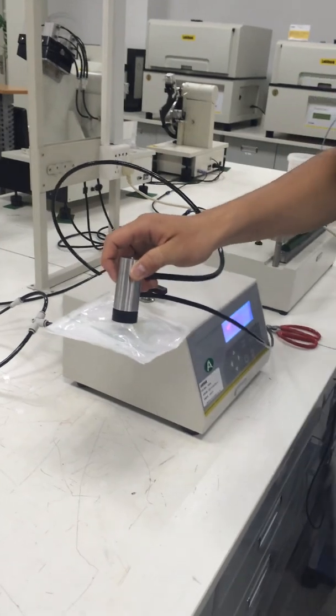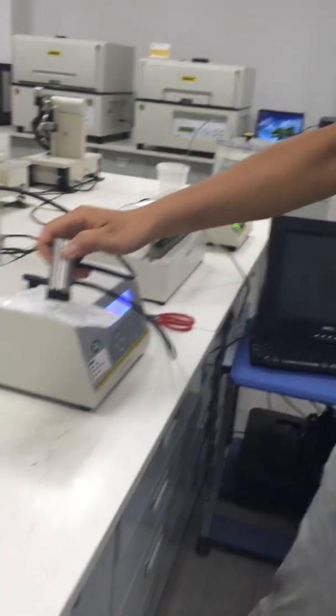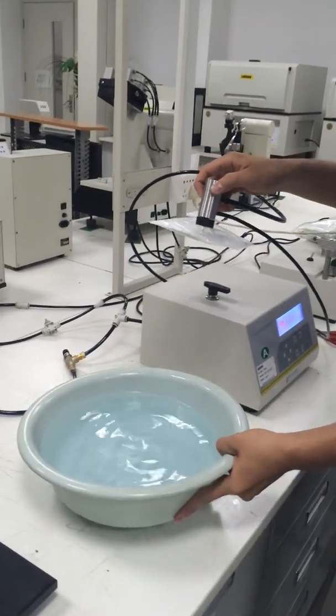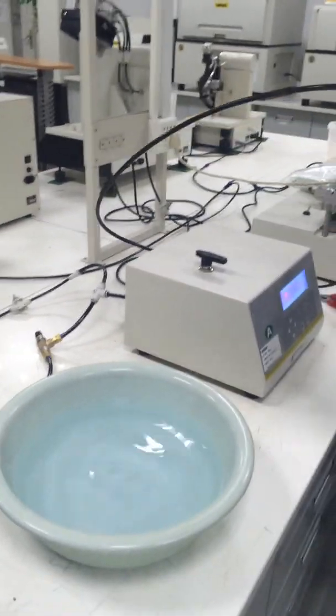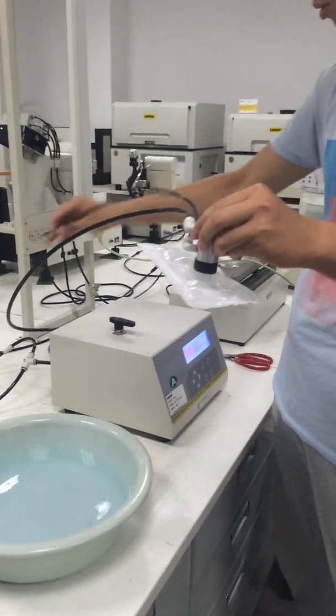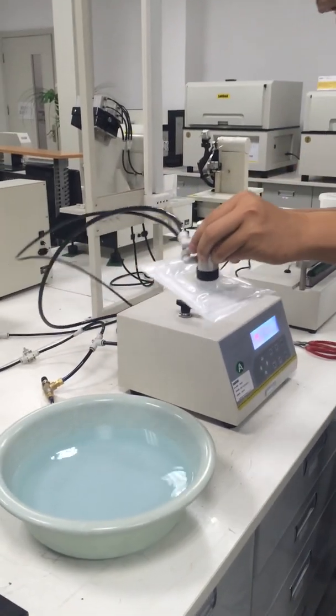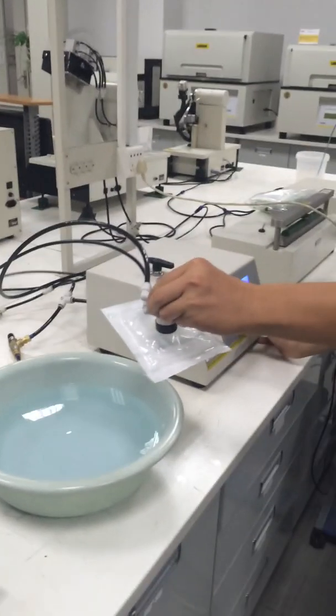Because I don't have the water tank fixture right now, I'm using this basin to simulate the water tank. Now I will perform one test to see how things are going.